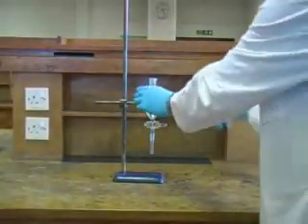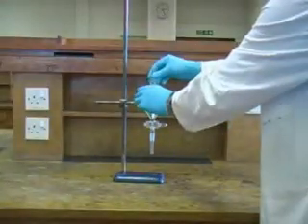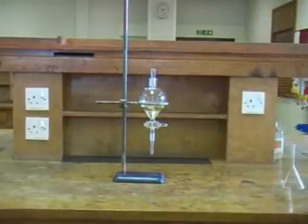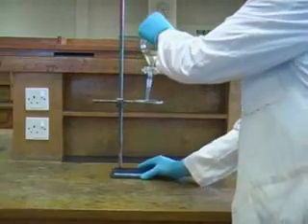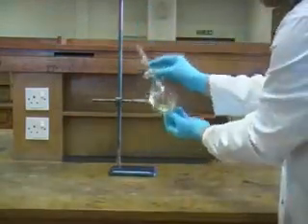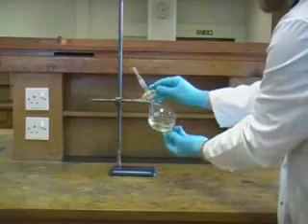Next you need to place a stopper in the neck of the separating funnel and you must ensure that you don't allow this to fall out at any point while you're handling the apparatus. Secure the stopper with one hand and carefully invert the separating funnel. Now you can gently shake the funnel while periodically opening the tap to release pressure.